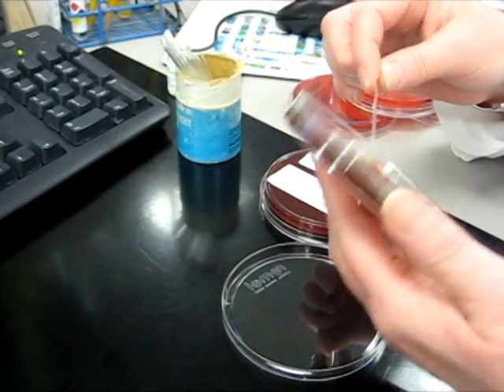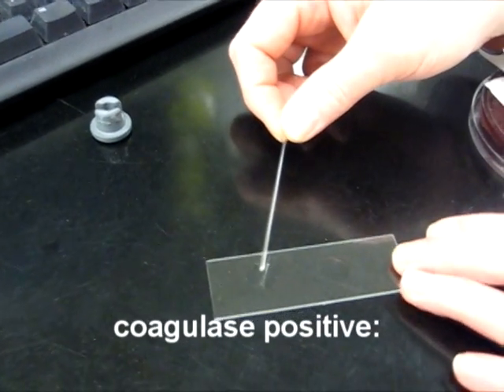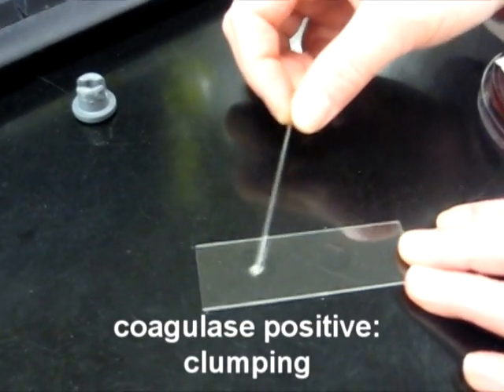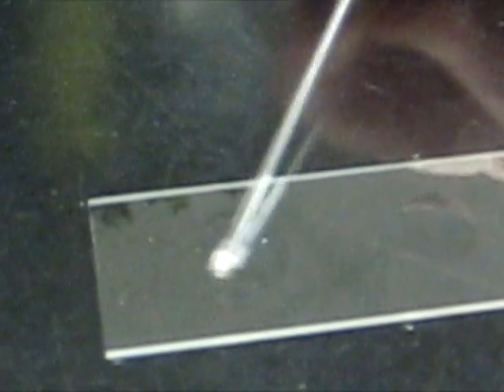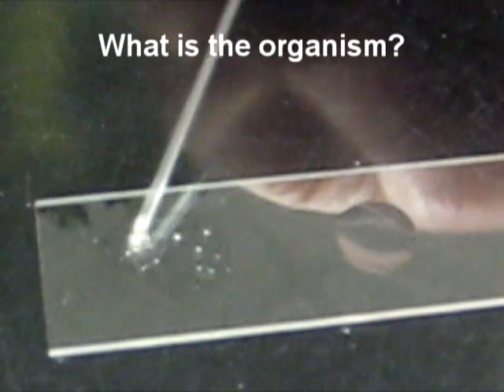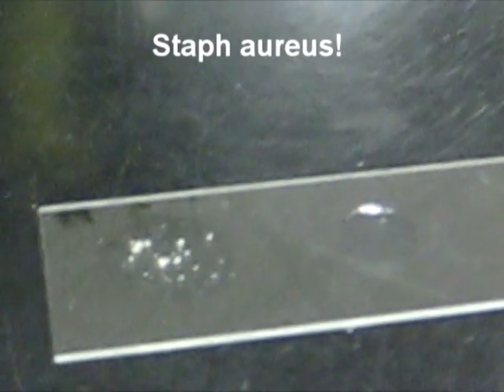If the organism is coagulase positive, you're going to get clumping when you add the organism to the reagent. The organism will not make a nice smooth suspension — it will stay clumpy. It looks clumpy. So this organism is staph aureus.